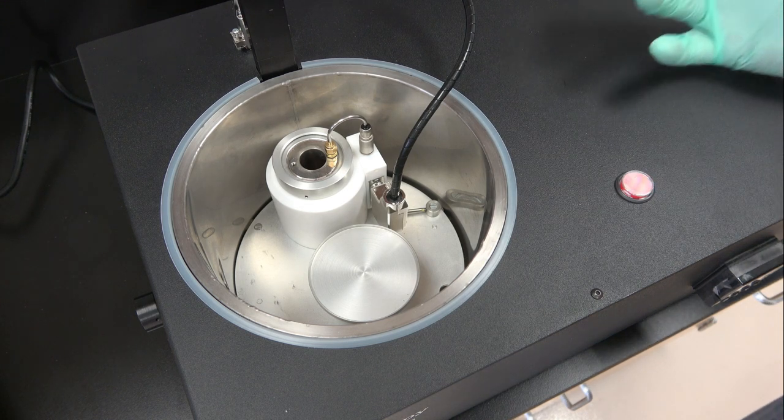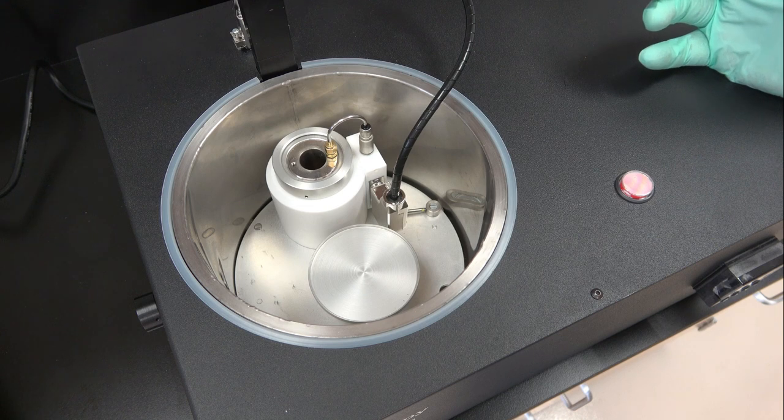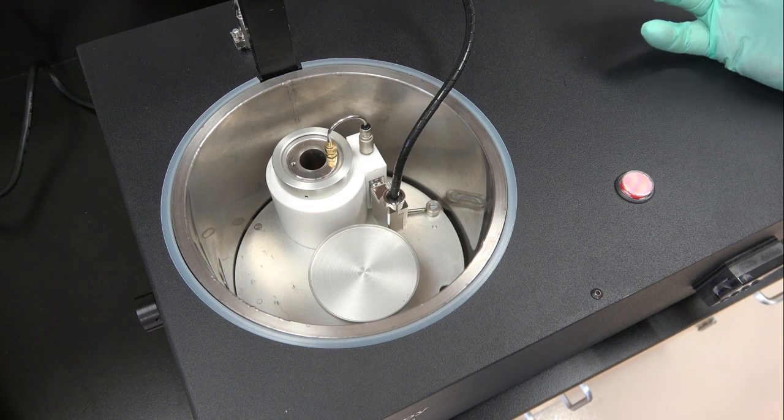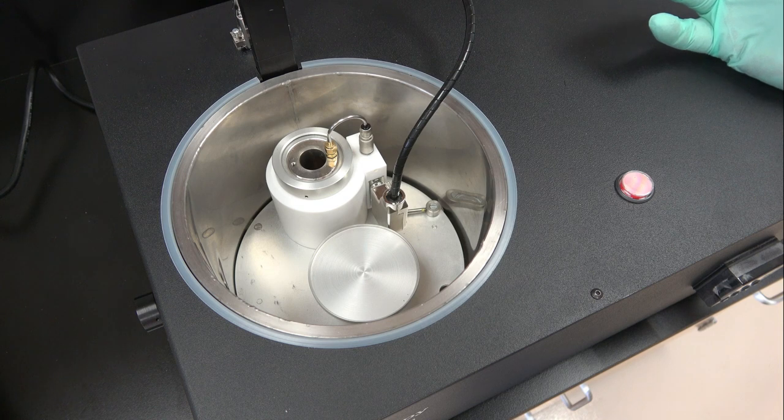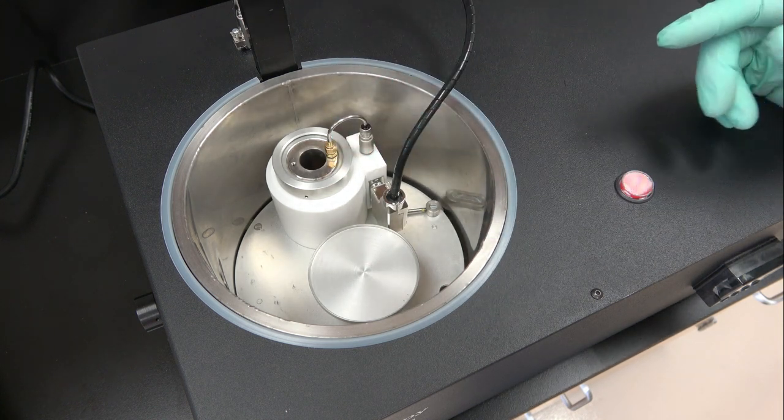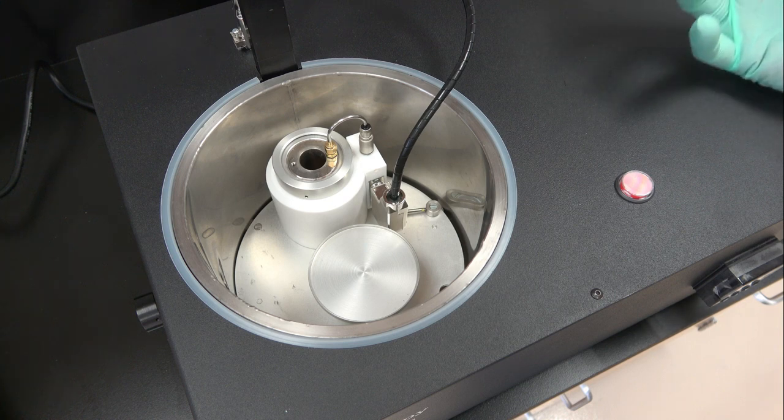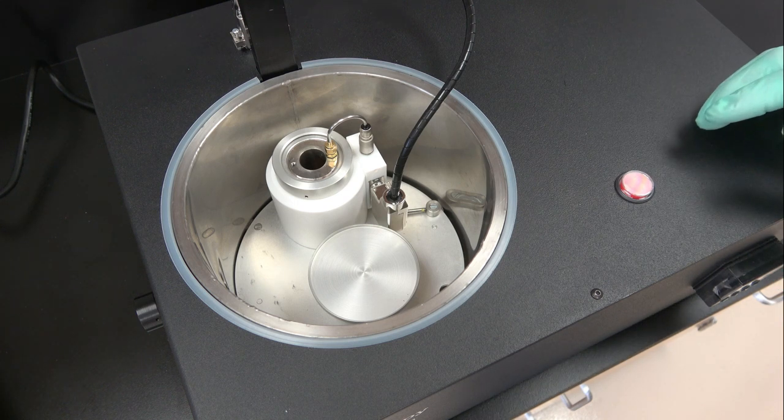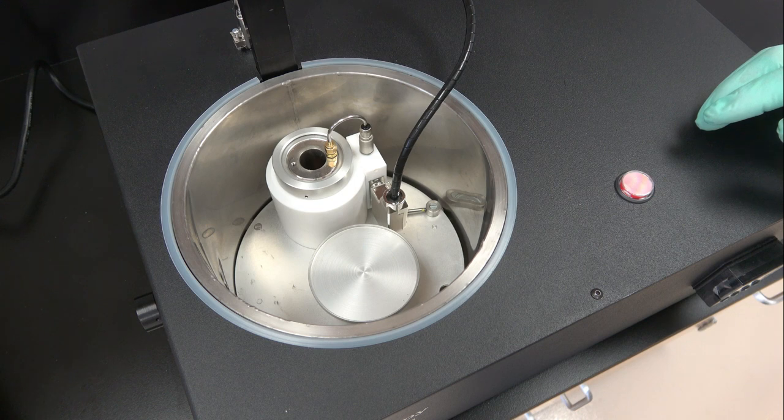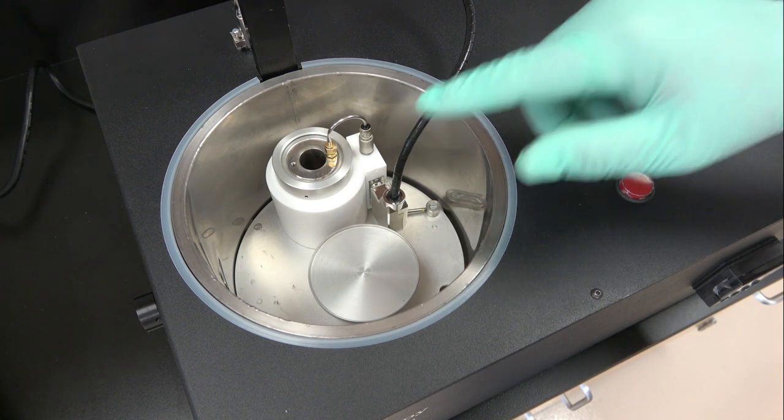At the end of the day when you're done freezing, ideally you want to put this in a fume hood, but you can also work with it on the bench top. You just have to remember that once there's cryogen in there you don't want it warming up because the vapors will start to accumulate, and that of course is a hazard. There's an alarm set on the temperature controller which will go off if the cryogen vessel reaches minus 100 or warmer.